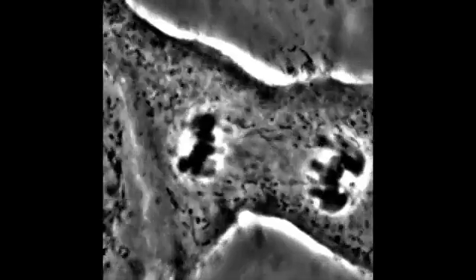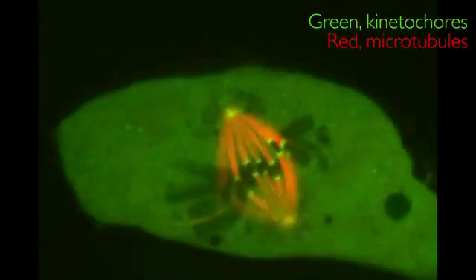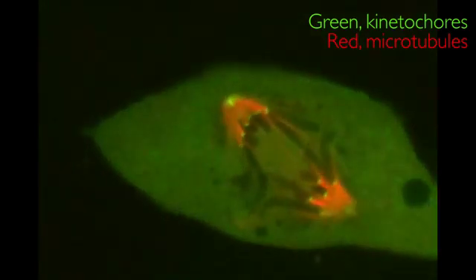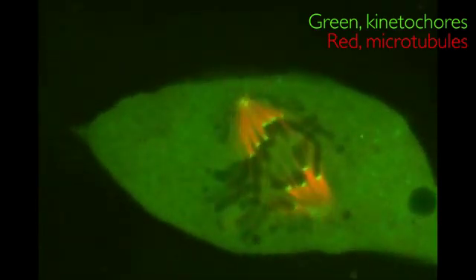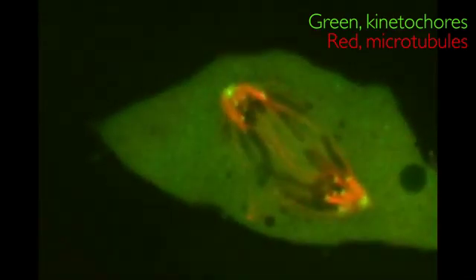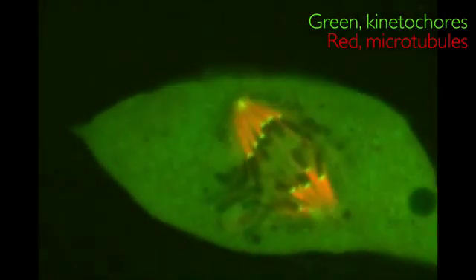The condensed chromosomes move around like an excited crowd in the center of the cell, until they are lined up in the middle. Then, quite suddenly, the sisters split apart and move to opposite sides of the cell, while the cell pinches in the middle to form two daughter cells. The microtubules of the mitotic spindle, shown in red in this video, bind the chromosomes at attachment sites called kinetochores, shown in green.